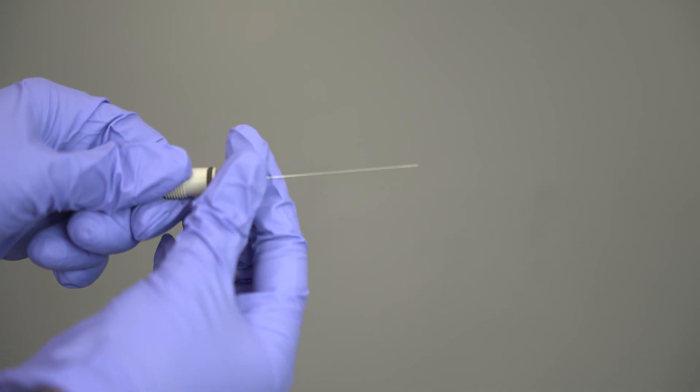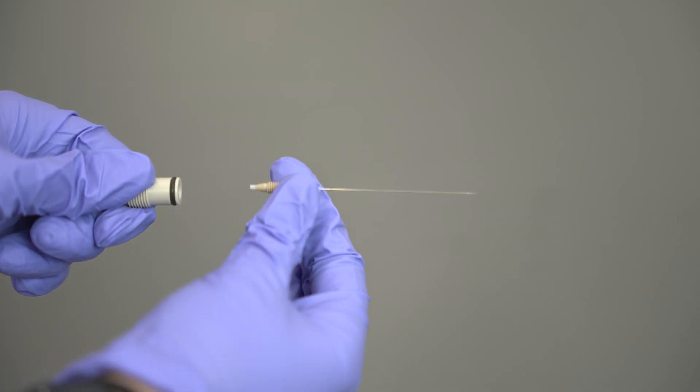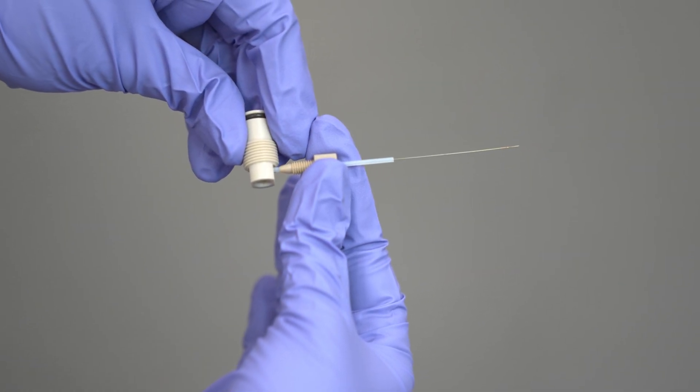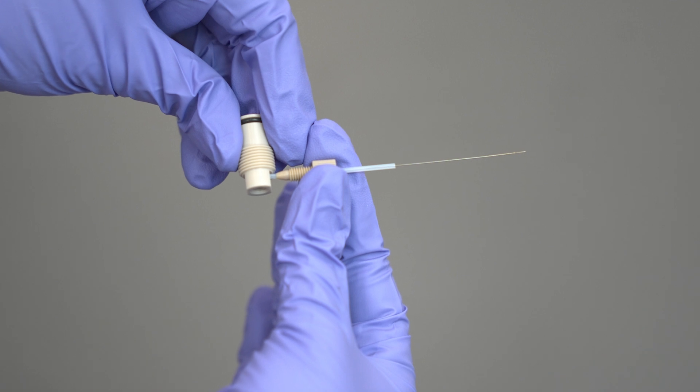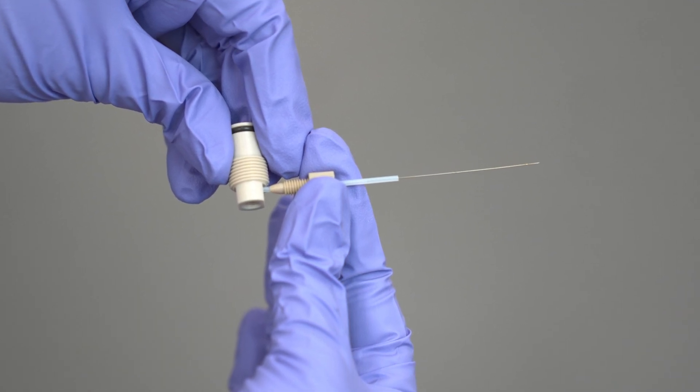Once the entire assembly has been removed, you need to disconnect the ESI coupling from the capillary assembly. Use the side of the coupling to help ensure that the tip of the ESI capillary is not nested too far into the assembly or projecting too far out.